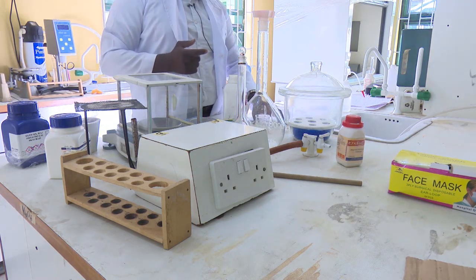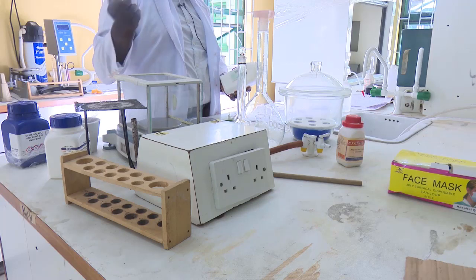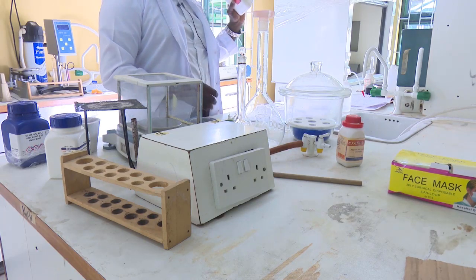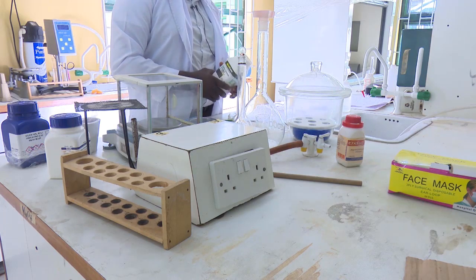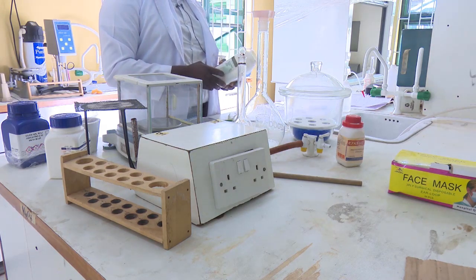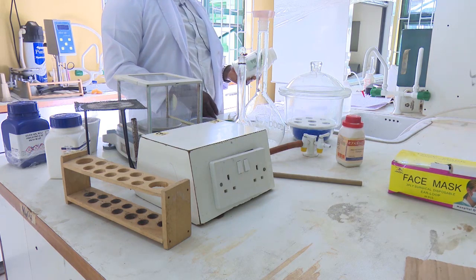The first thing you need to do is to take your salt and know the molecular mass of your salt, just as we were told in class. If you look at the body of the plastic container, you may see the exact mass of the compound. You may wish to use that, but otherwise you can do your own calculation. The calculation of the mass is done by summing up the composing elements.